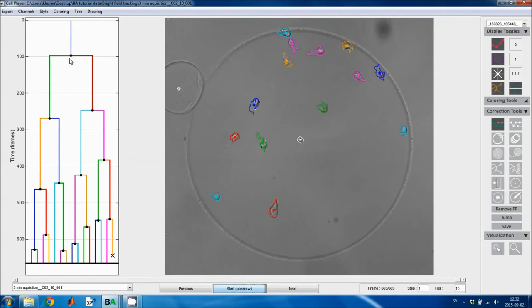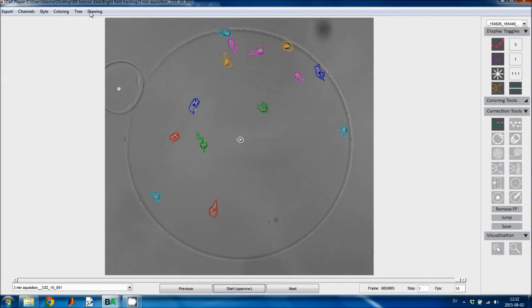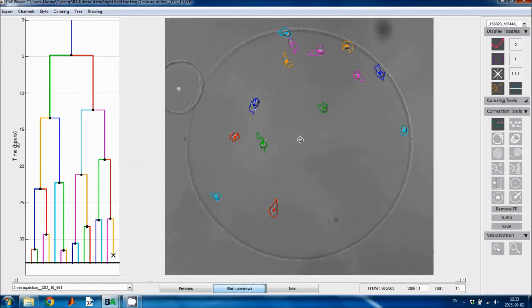And then there's random colors, and in this case the cells are given random colors from a set of fixed colors. In this case the daughter cells will never be given the same color. And then you can select whether or not you want to show the lineage tree. You can also select that you want it in a separate window, and you can select that you want to show the time axis in hours instead of frames. This drop-down menu gives options for cell segmentation editing or outline editing, and I'm going to make a dedicated tutorial on that topic, so I'm not going to go through them now.